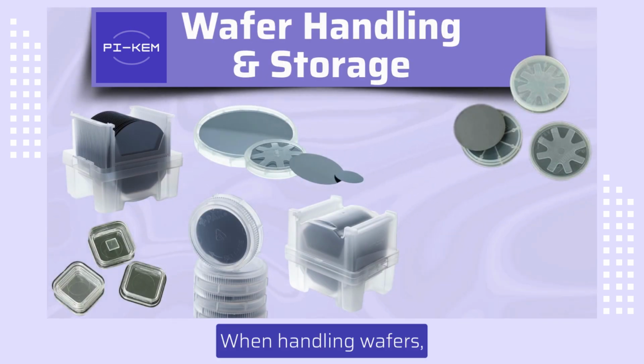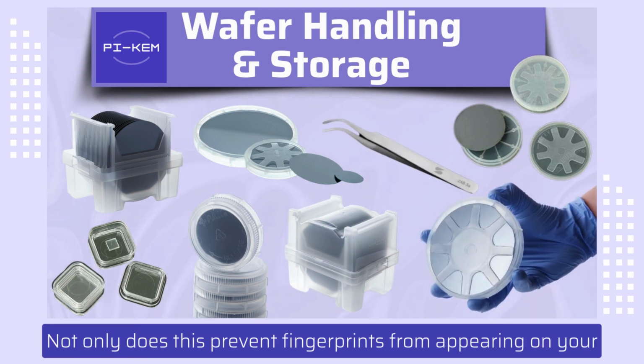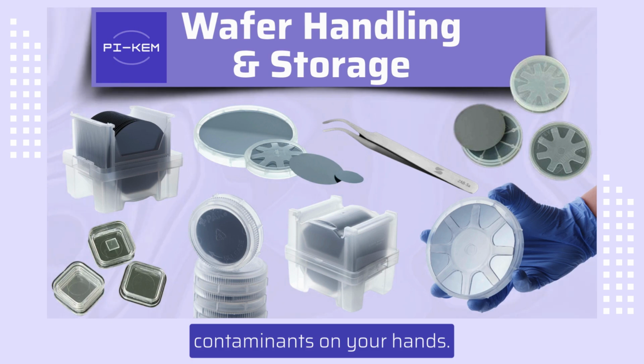When handling wafers, it is ideal to use either gloves or tweezers. Not only does this prevent fingerprints from appearing on your wafer surface, it also prevents the transfer of other potential contaminants on your hands.